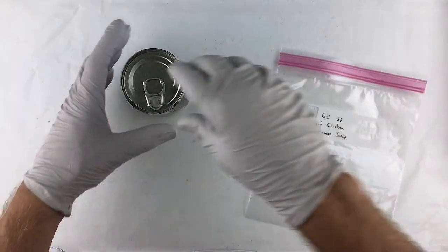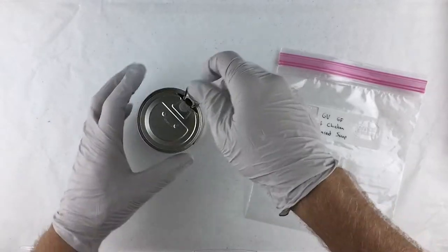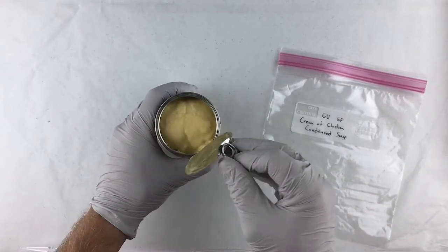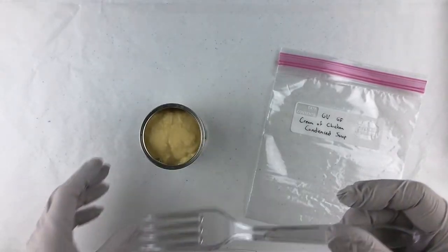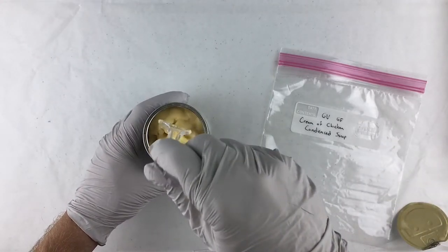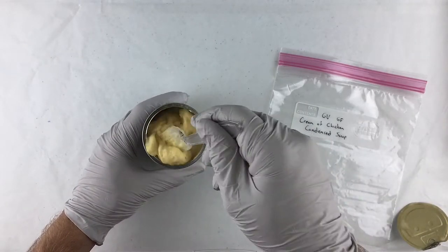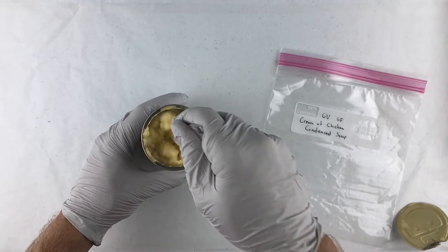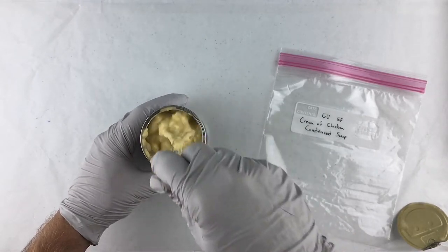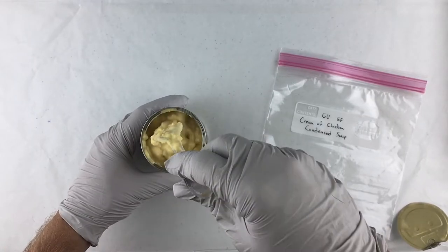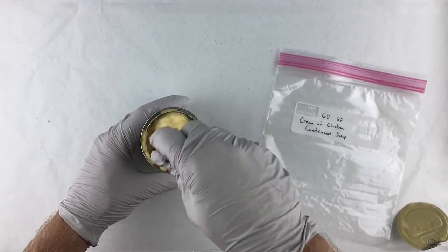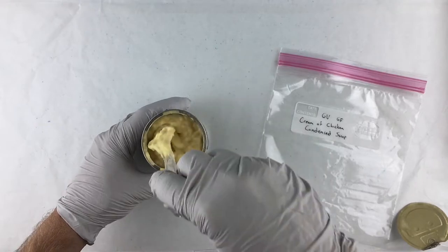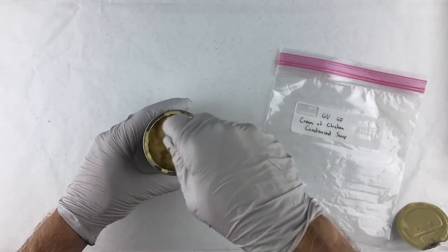So we'll go ahead and break it open here. I'm going to attempt to just stir this up a little bit instead of putting it in the blender. I want to make sure it gets mixed well. Honestly, there are some of these products that I question whether they actually need to be blended. So I'm just going to try to stir this around.